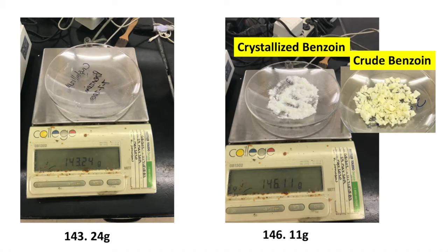And if you compare it to the crude benzoin, I have a picture here, you can see the yellow color of the crude benzoin is pretty much all gone. So it looks like that yellow color was an impurity.